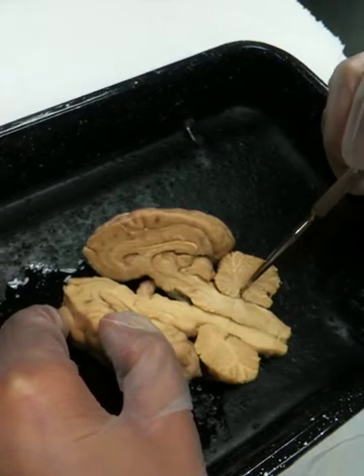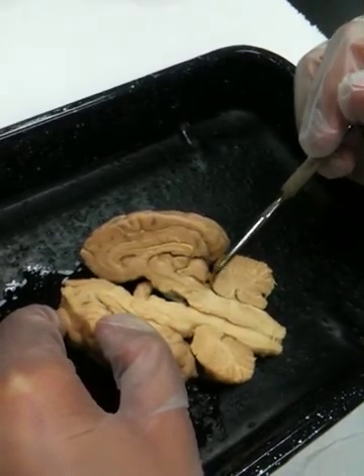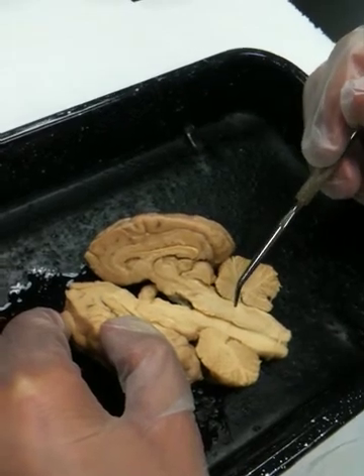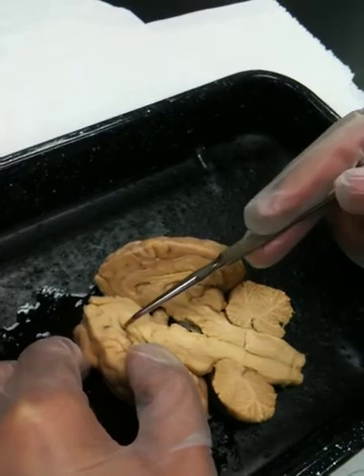Okay, going back up here, I'm going to look at the corpus callosum. I think I'm going to switch us back again. Look at this one, a little better here. Okay, so she should have stayed with that other half. It's better actually on the other.